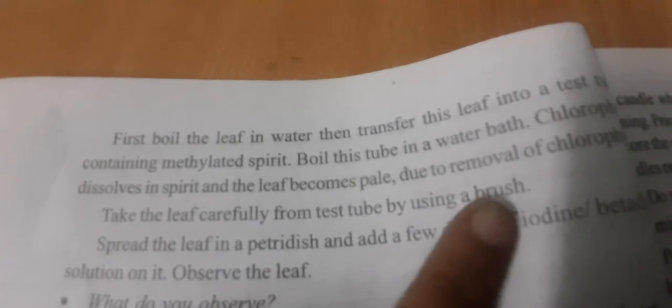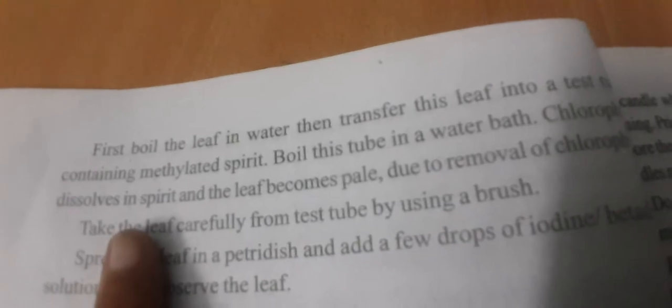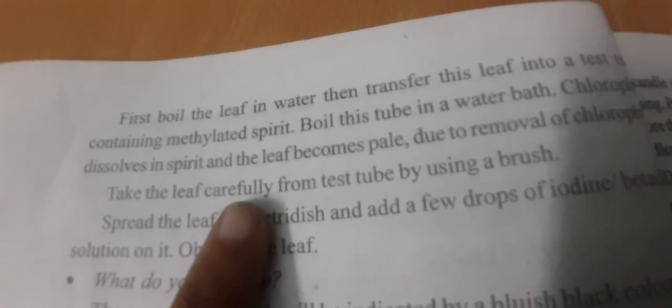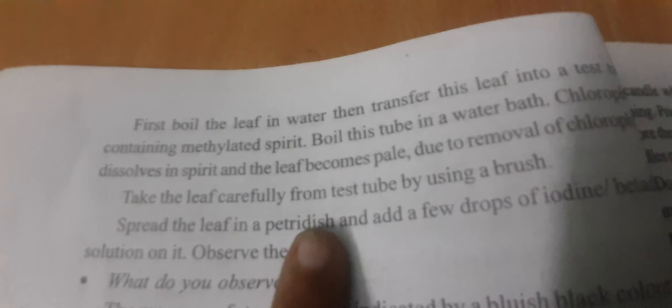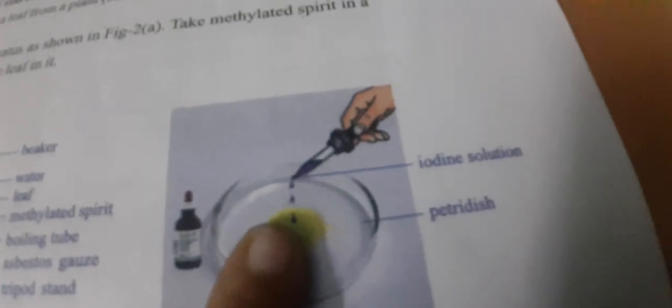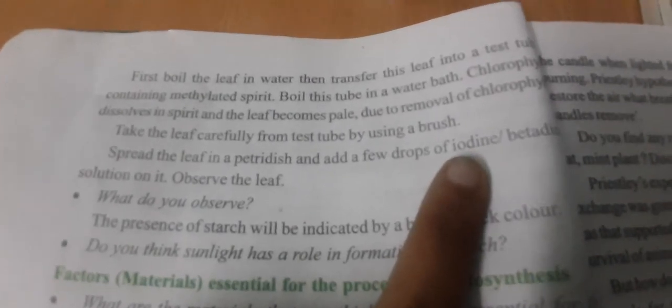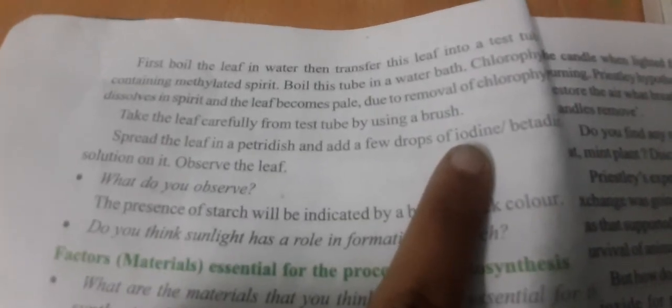Take the leaf carefully from the test tube using a brush. After taking it out, spread the leaf in a petri dish. Here you can see this is a petri dish — the leaf has become pale yellow in color. Add a few drops of iodine solution onto the leaf in the petri dish.